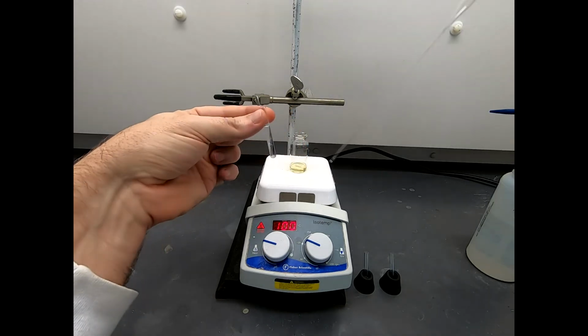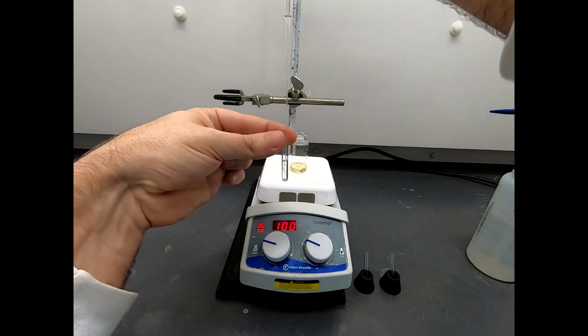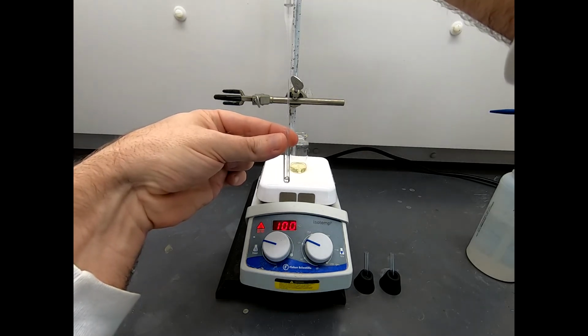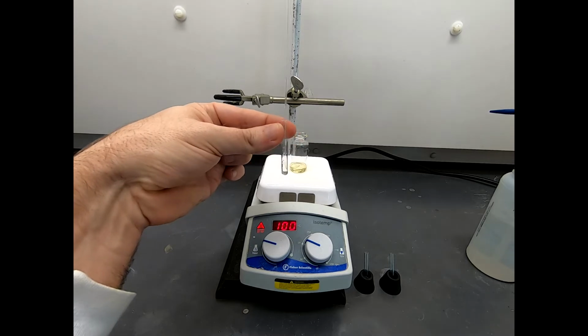Takes maybe not a full drop, maybe more than a full drop, I don't know. Okay, so that dropped down. I don't know if you saw it sink. I'm now going to use this pipette. I'm going to suck up this whole thing. Got to be a little careful when you do this, because it's easier to squirt too vigorously in your test tube and just shoot everything all over the place.